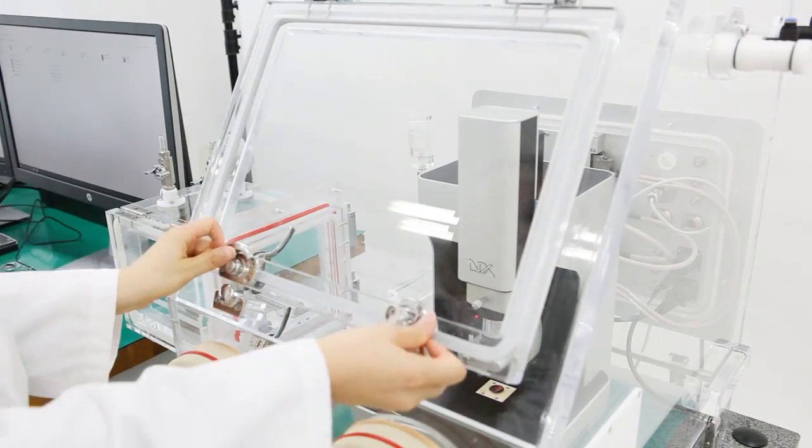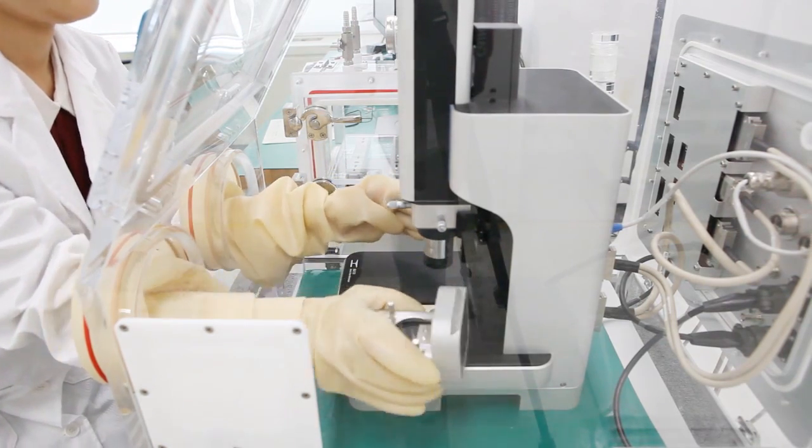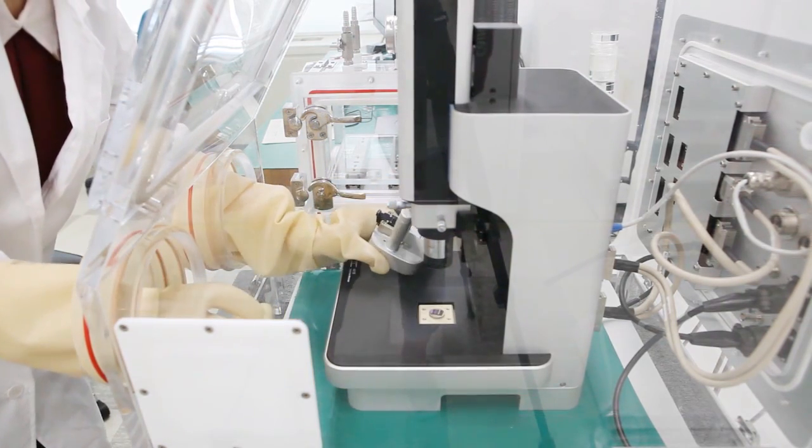After closing the door and setting the desired atmospheric conditions, use the pair of gloves on the front ports of the main chamber for internal handling.